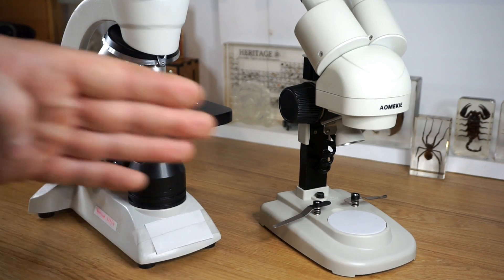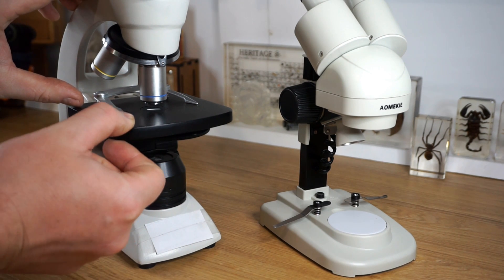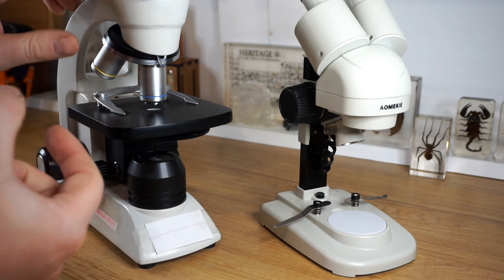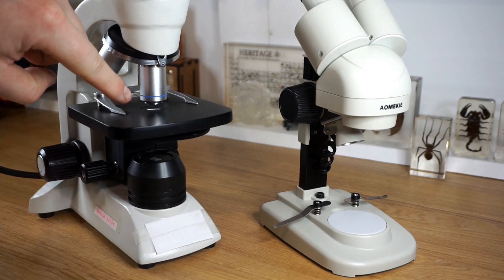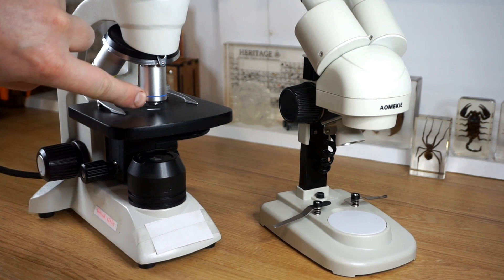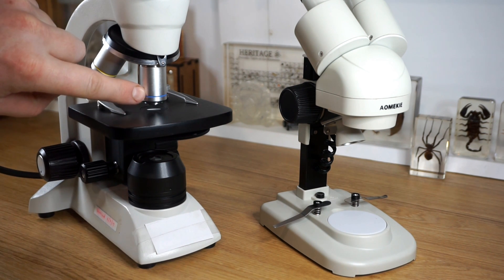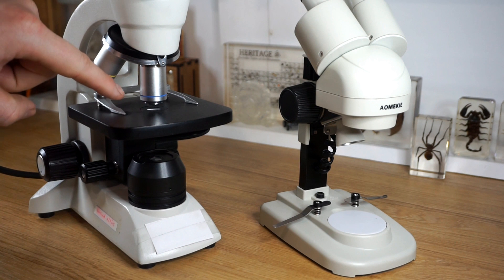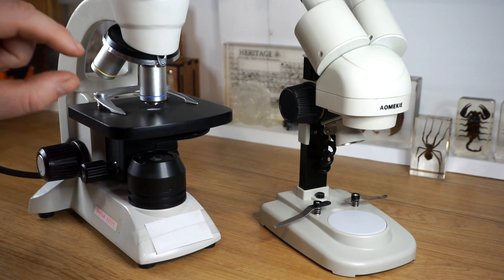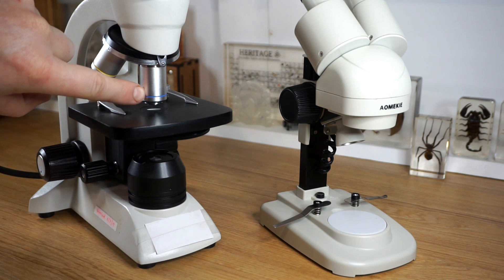Another key difference between these two microscopes involves the stage — that's the part where you place your specimen, which is the thing you want to look at. With the compound microscope, there is only a few millimeter gap between the stage and the bottom of the lens. The specimen can't touch that lens or it could damage or scratch it. So whenever you're looking at something with the compound microscope, it has to be very, very small or a very thin slice to fit between the stage and the lens.